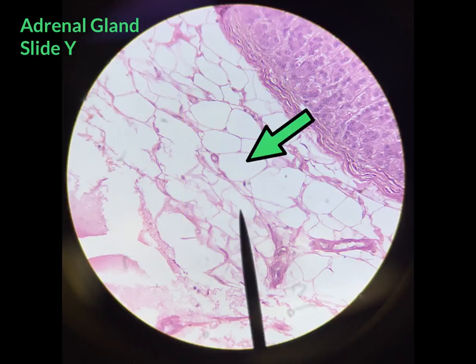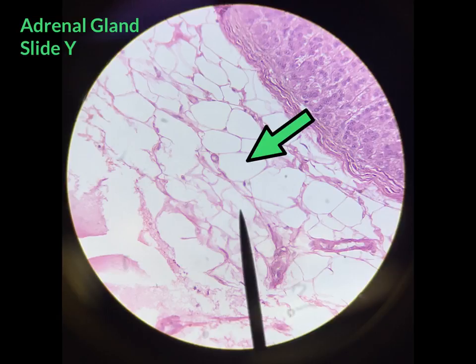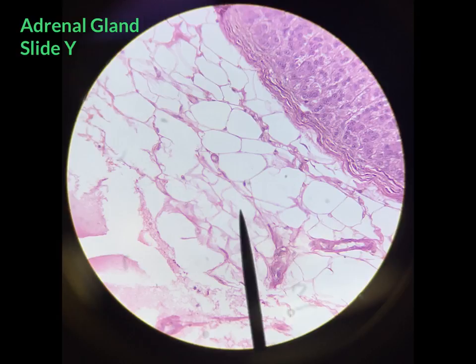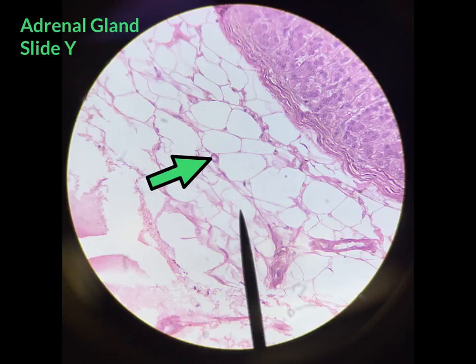The wide area that you see within the cell is where adipose or fat would be stored. Because adipose takes up most of the area within the cell, the nucleus is pushed up against the cell membrane.